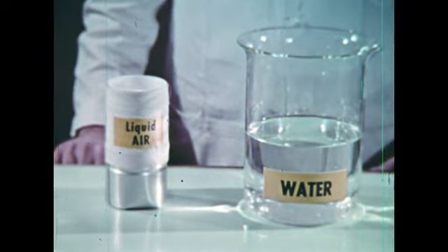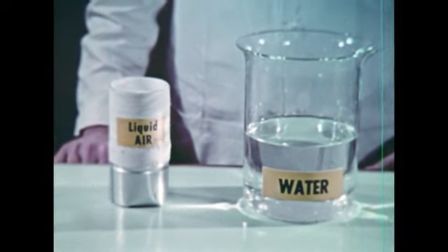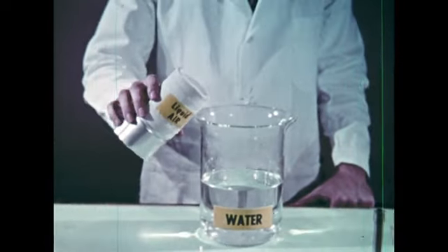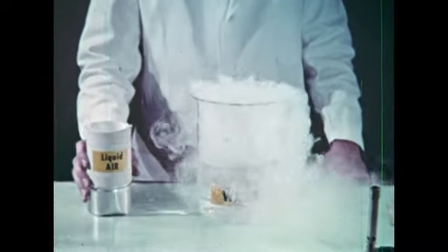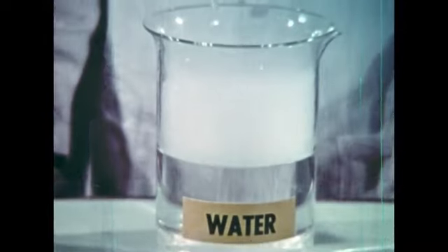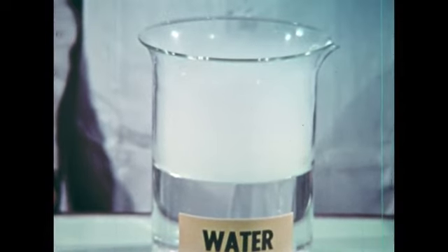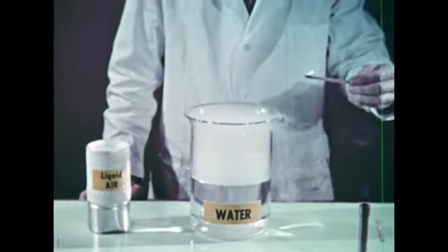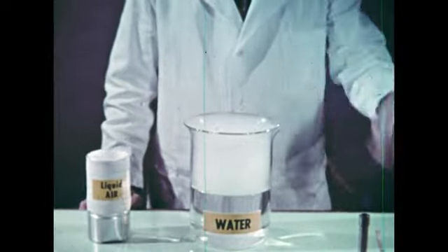The fractional distillation of liquid air method to produce oxygen depends on the different boiling points of nitrogen and oxygen. Therefore, it's also an example of physical, not chemical, change. The liquid air floats on the water and evaporates. Nitrogen boils off before the oxygen because it has the lower boiling point. The combustion test this time shows that little oxygen is present in this vapor. But when we try it again, we see that we're now getting oxygen gas.